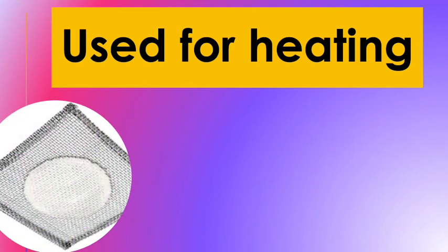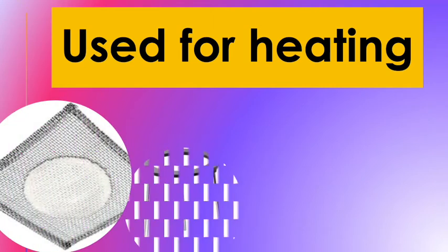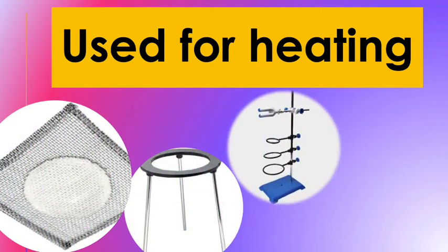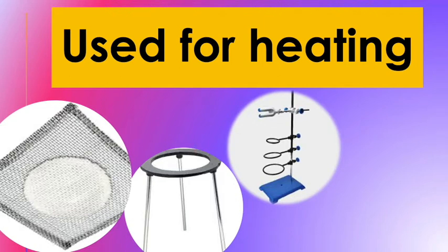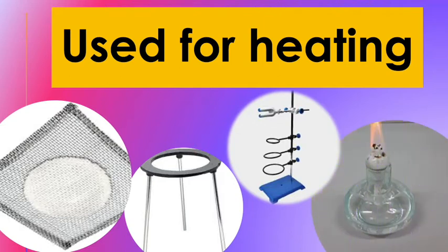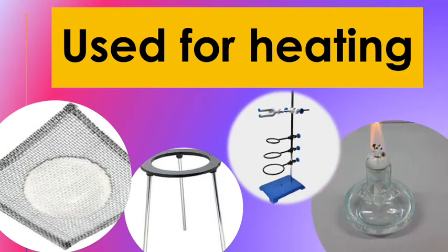Again, the laboratory tools that are used for heating are: wire gauze, tripod, iron stand with ring and clamp, and alcohol lamp.